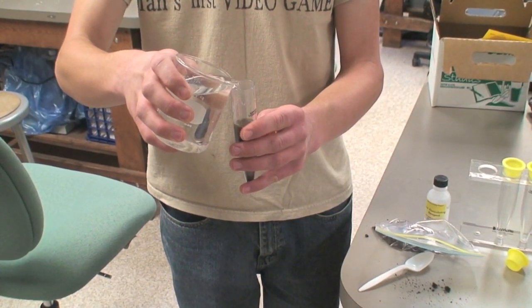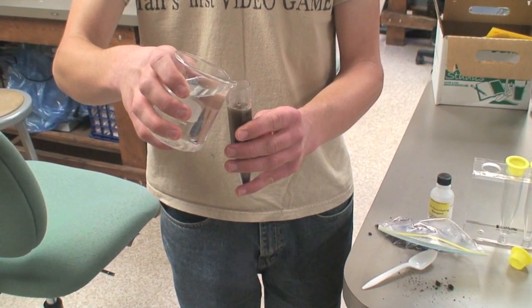Fill the tube with tap water up to the 45 milliliter line, then cap the tube and shake for two minutes.